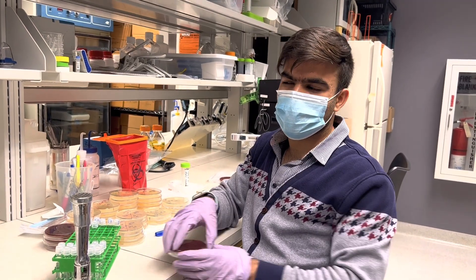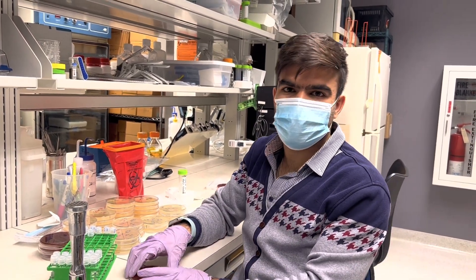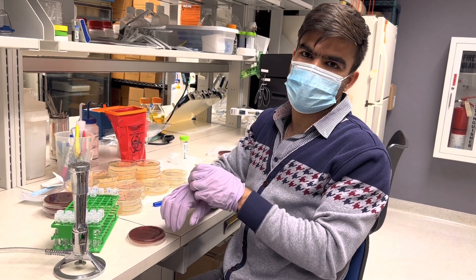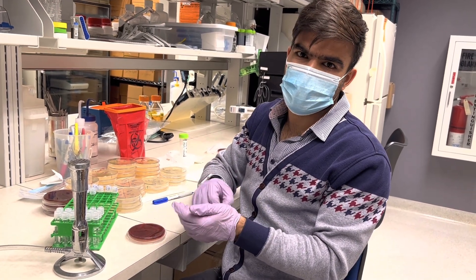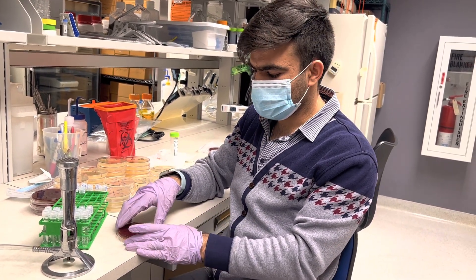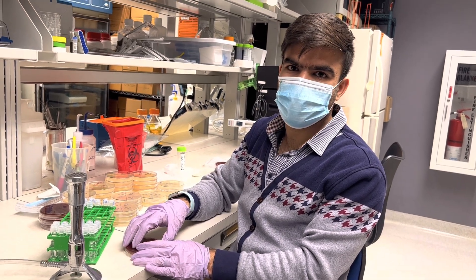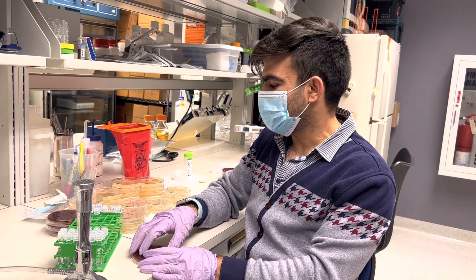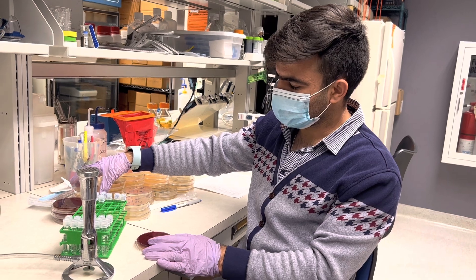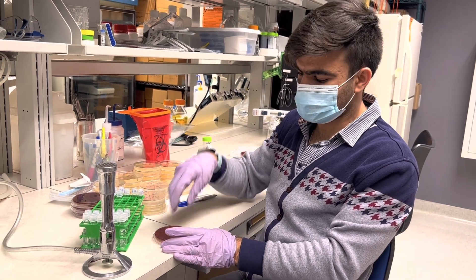Hi everyone. I'm going to do the McFarland test in order to standardize the bacterial turbidity or concentration, to inoculate them on plates in order to determine their antimicrobial susceptibility.